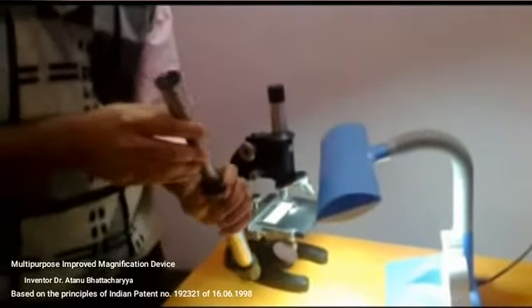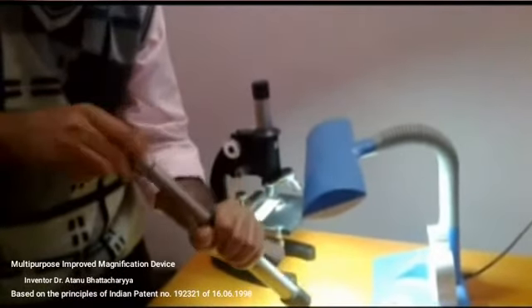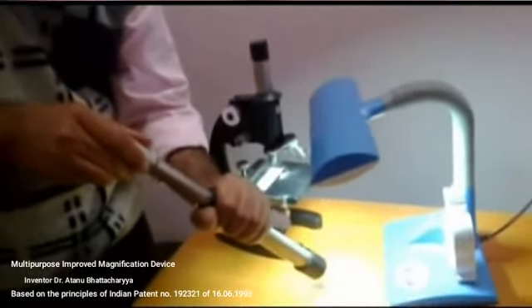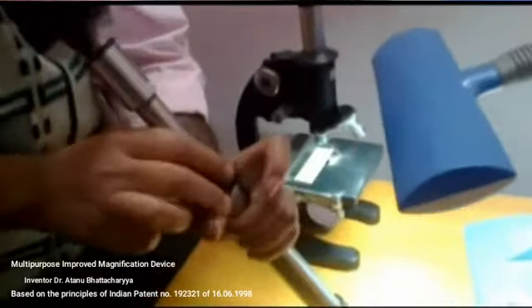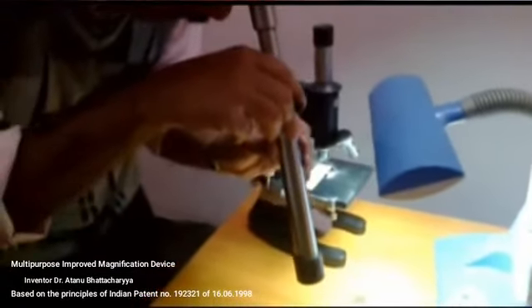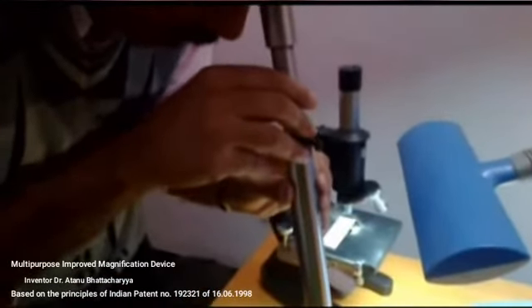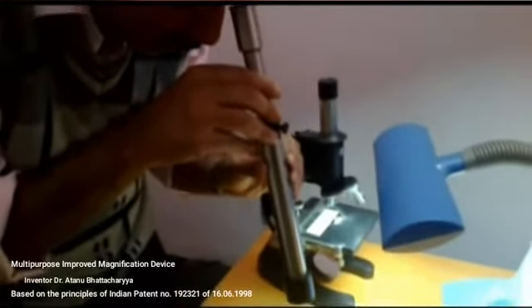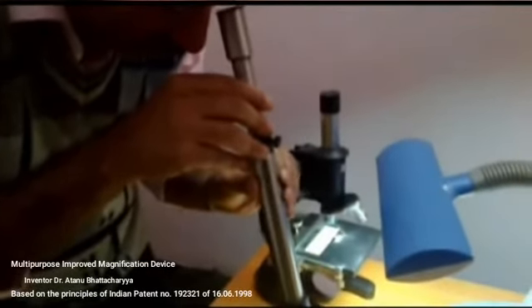Now if I wish to reduce the magnification, then I have to push the T1 tube into the T3 tube. I am now pushing it. I have pushed it, and then again I have to keep my eyes on the eyepiece and move upward and downward. Practically after pushing the tube, I have to move upward more, because the distance between the object and the objective has to be increased in that case. So in this position I can see the fibers of the table.